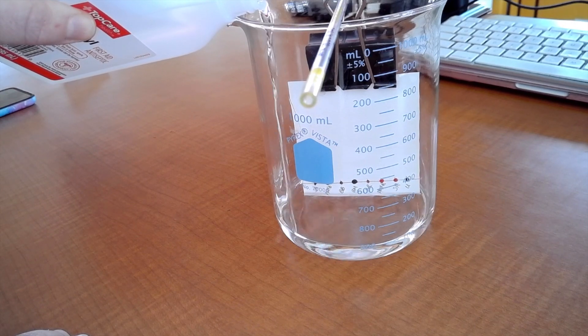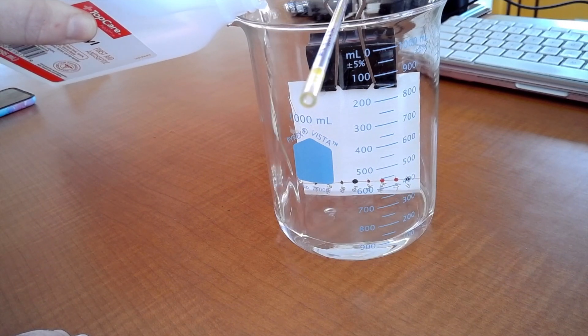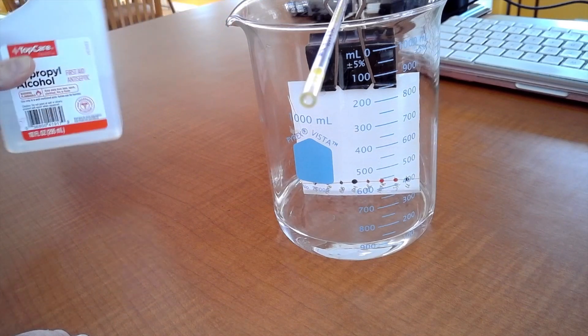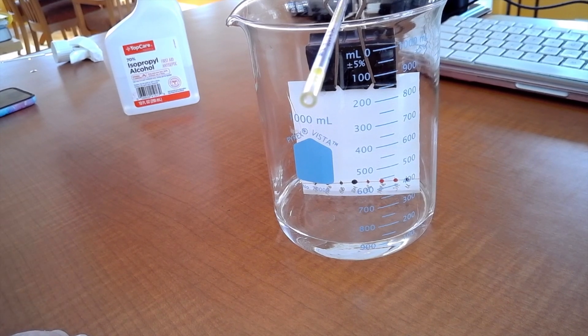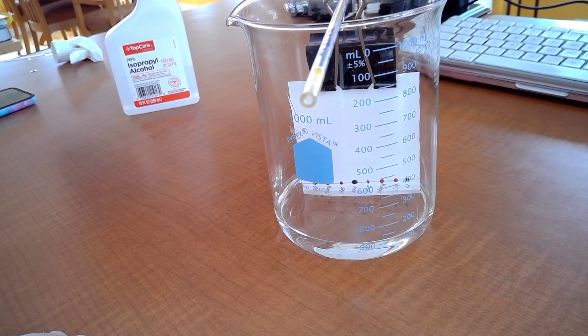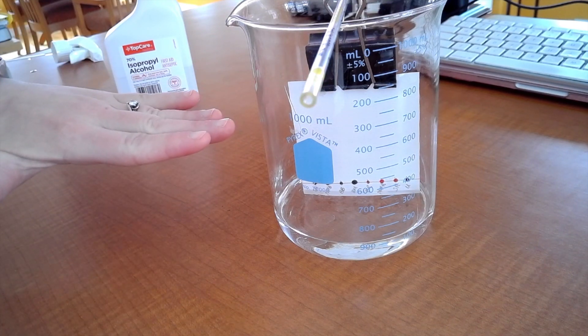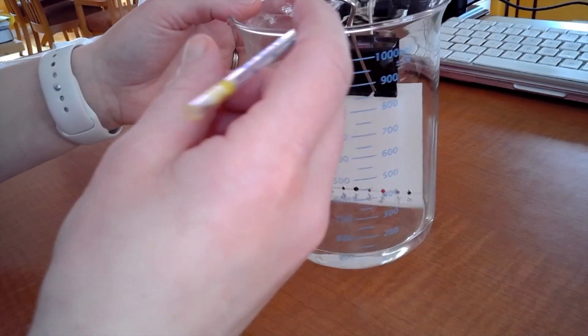So I'm going to pour this in and I have it set up and as it touches the paper you'll see when it touches the paper and you just watch and you want it below that line and the ink so that the capillary action will actually cause that alcohol to move up the paper and start to actually separate the inks from the markers and the pen. So this, you'll just this is the sit and wait. You can see it's already starting. When this goes about halfway it's done. I'm going to sneakily turn this around right now.